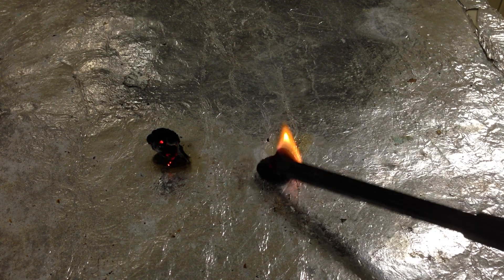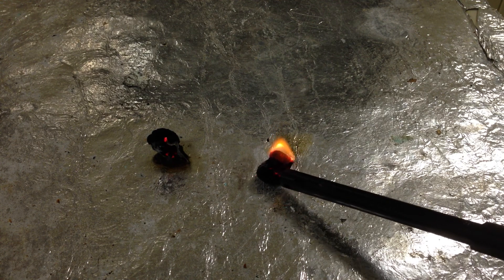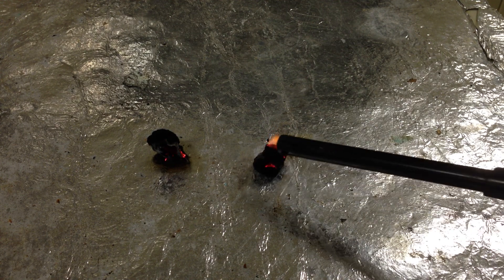You saw the flame and the heat giving off because we're making stable compounds. Now this wasn't a very fast reaction because the oxygen in the air had to hit the carbon. So only the exposed carbon on the outside was able to react with the oxygen — the carbon on the outside.